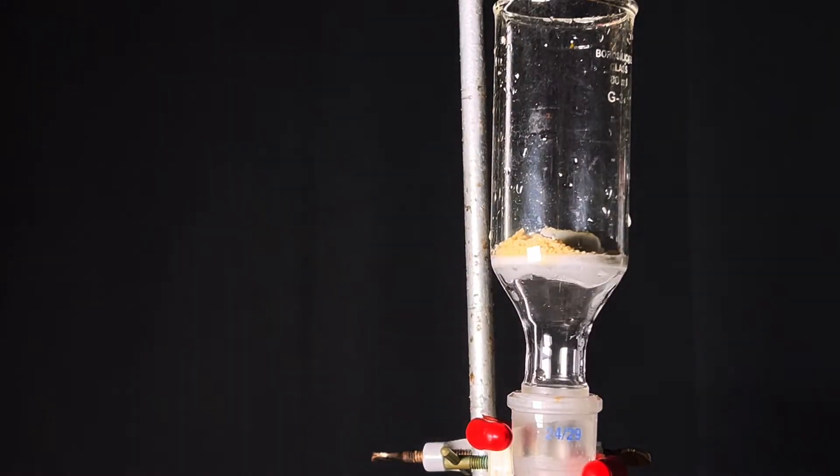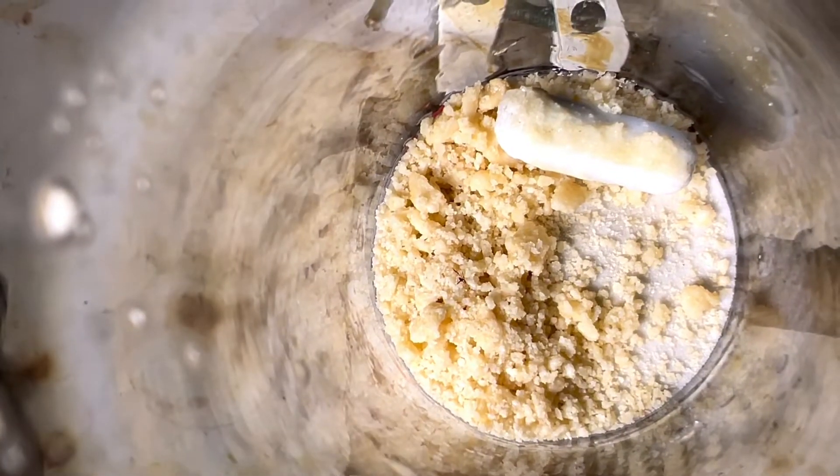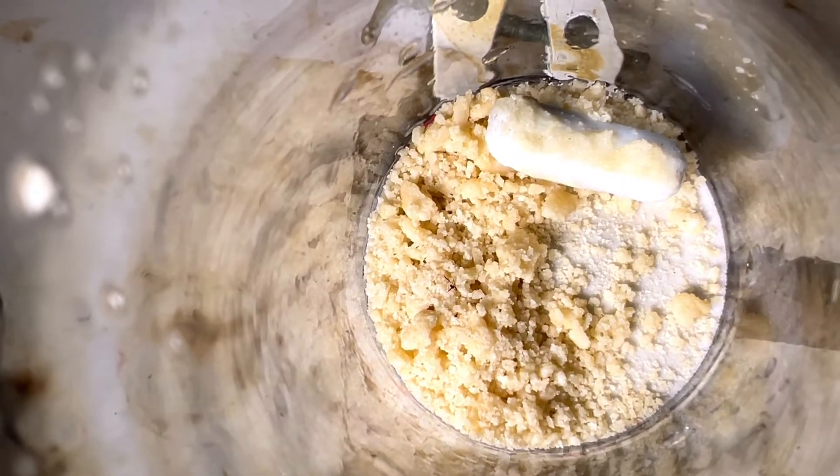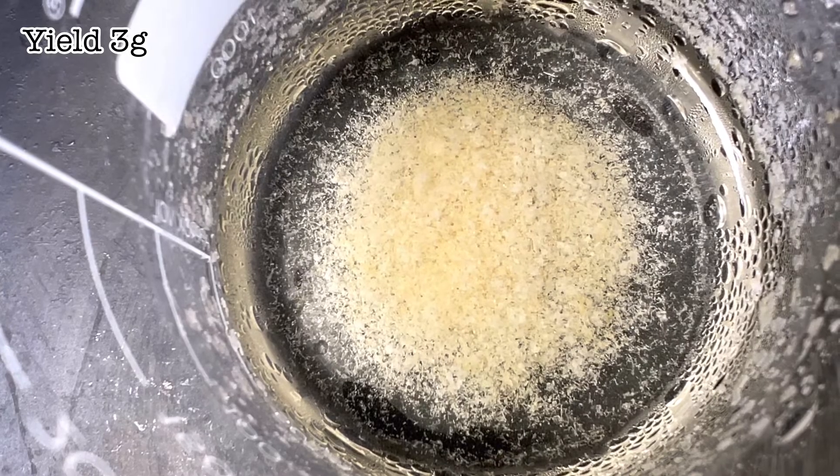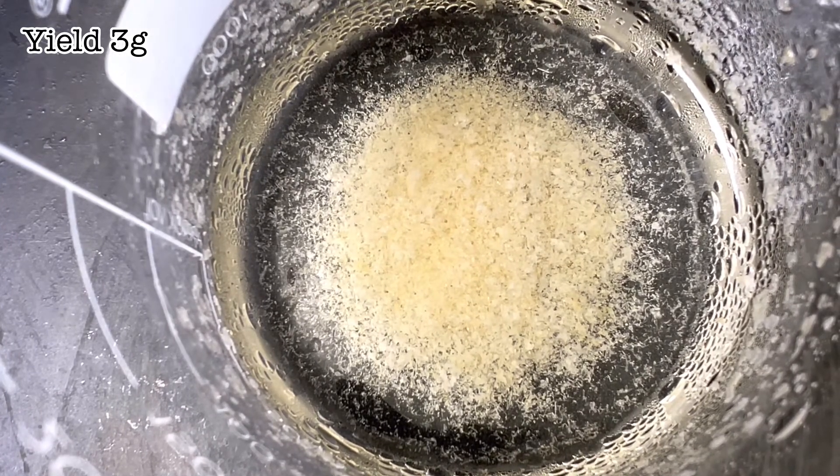It was then vacuum filtered and collected. A small portion of it was recrystallized from 70 percent ethanol-water mixture. The yield that I got was 3 grams.